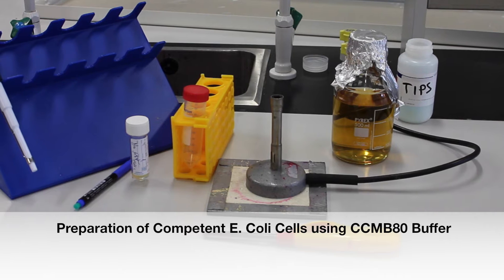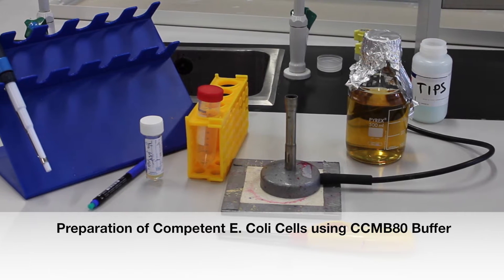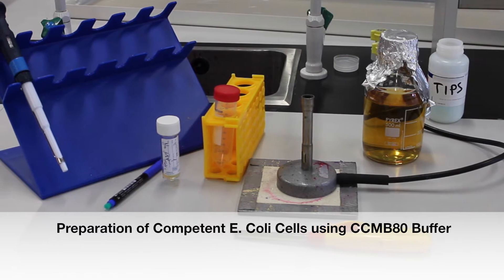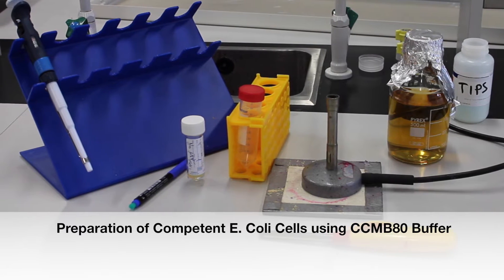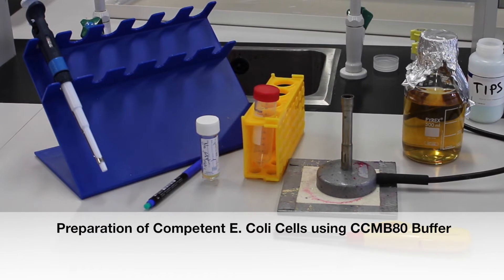This video is part of the iGEM Academy series, a beginner's guide. This tutorial explains how to prepare competent E. coli cells using CCMB80 buffer.